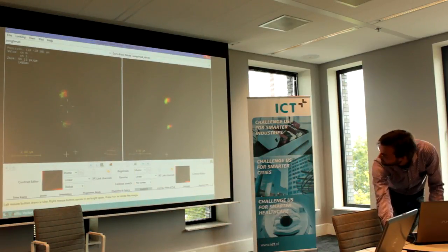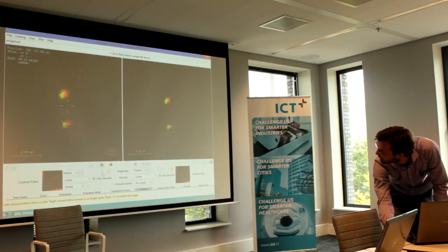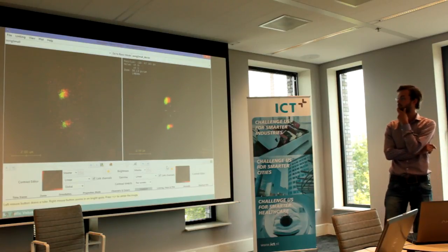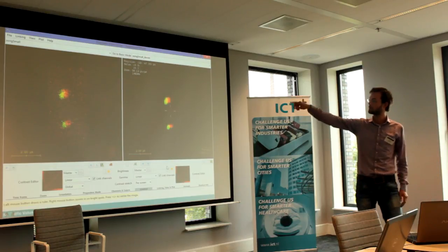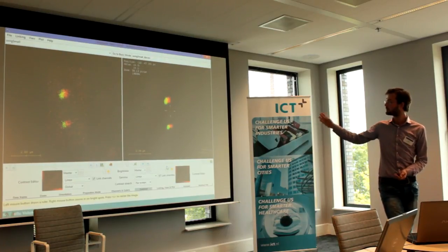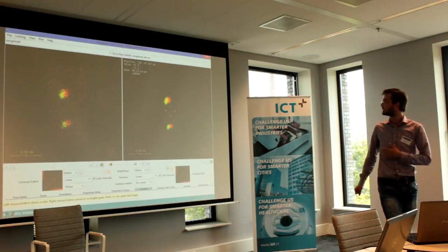So here we have an example image. I will just put the brightness a little bit up. What we use as a test image for the chromatic aberration, you can actually see that the red and the green channels are not lined up. You have a green blob and a red blob and they're not lined up. And you first have to deconvolve it. You can actually see the result on the left and you can really see they're not lined up. So our software will line these images up and then you get a better image.